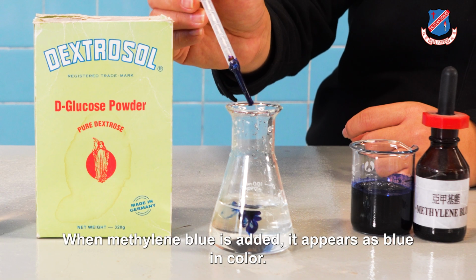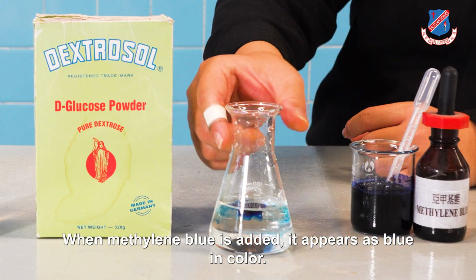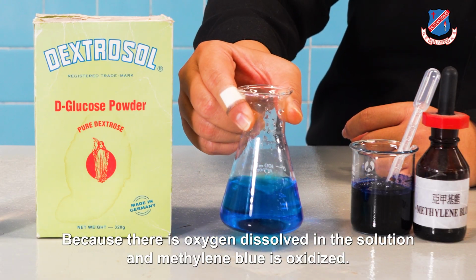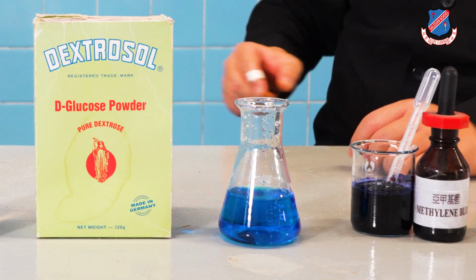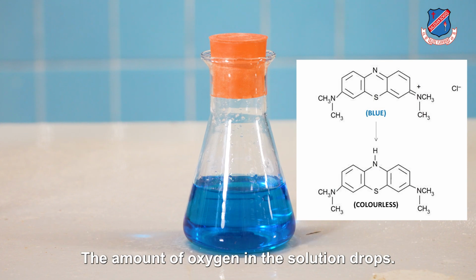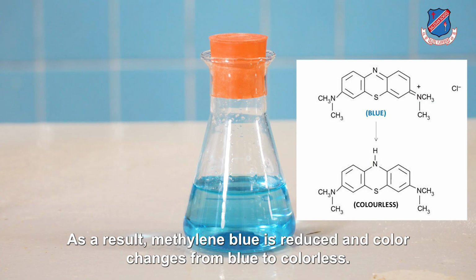When methylene blue is added, it appears blue in color because there is oxygen dissolved in the solution and methylene blue is oxidized. But after a while, because of the reaction between glucose and oxygen in the solution, the amount of oxygen in the solution drops. As a result, methylene blue is reduced and the color changes from blue to colorless.